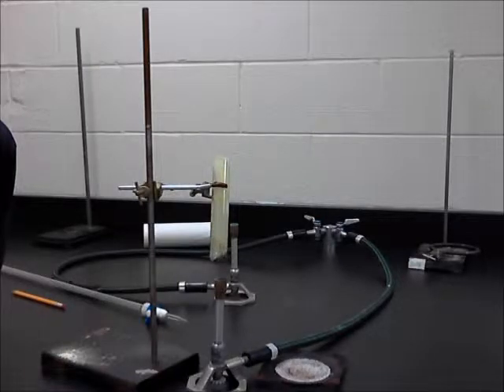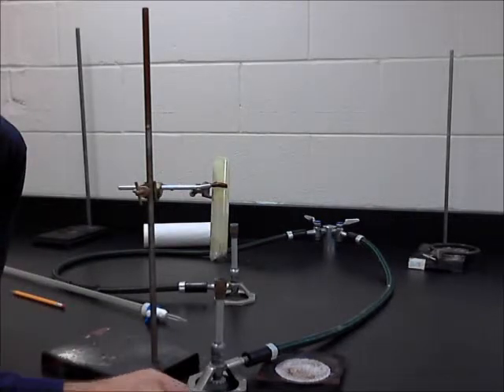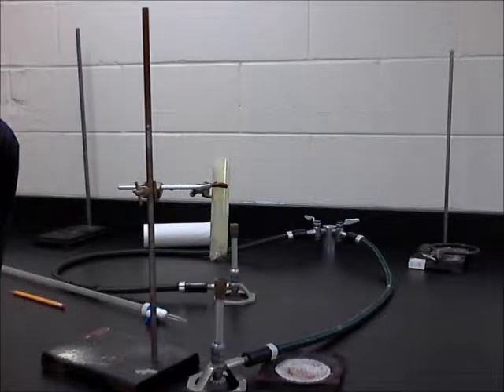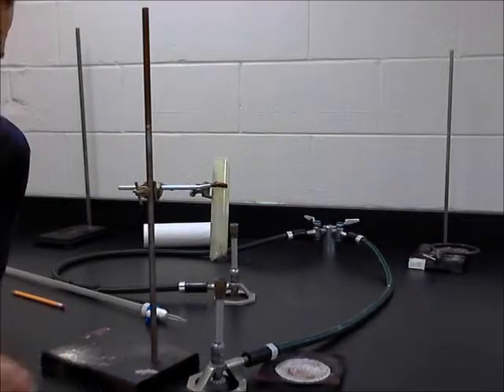Alright, the first thing it says is procedure one: at your station you should have a test tube and two beakers, which I have down below here, and if you don't have these, find them. I also have a stir stick here as well. Number 2 says mass solid samples of 4.5 grams and 1 gram of copper and sulfur respectively. I did that. Use your individual beakers to hold the samples.